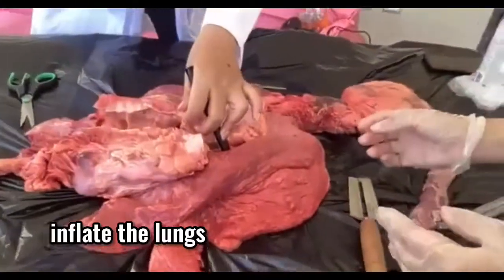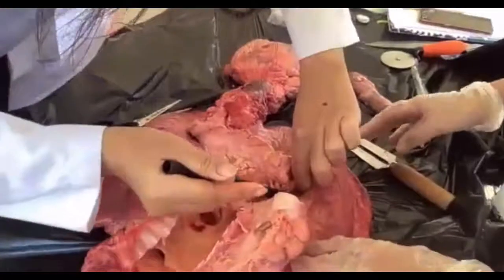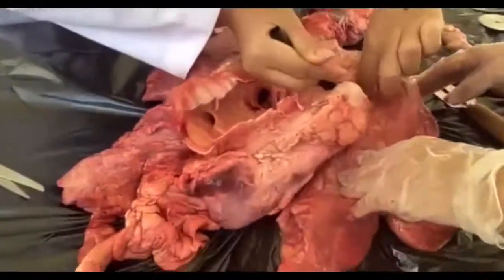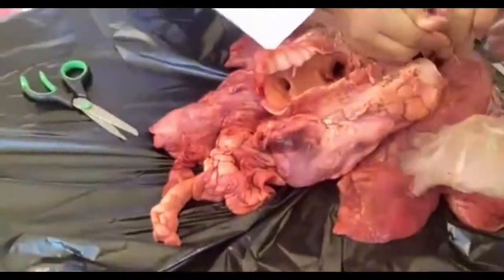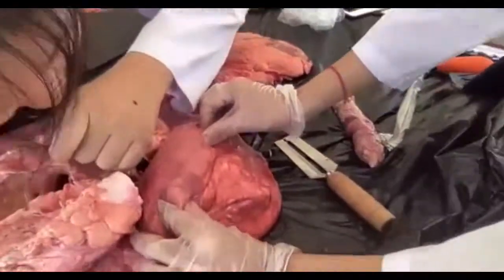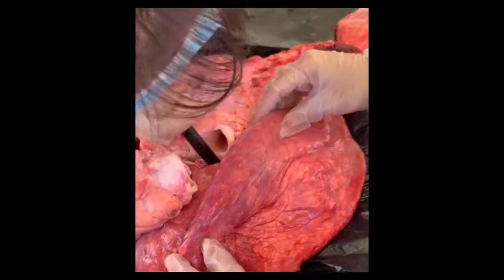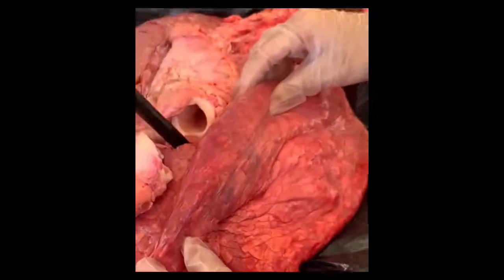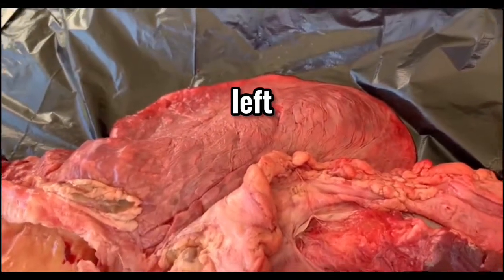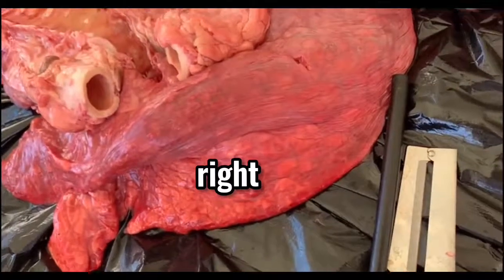Next, you will inflate the lungs. Use a tool that can inflate them. In this case, we'll use a thick straw. Put one end of the straw into one of the bronchi and start blowing in order to inflate the lungs. This shows us that the trachea, which is connected to the bronchi, transports air directly into the lungs. As you see the lungs, you will notice that the right side is bigger than the left side. This is because the heart is located on the left side and it occupies space.